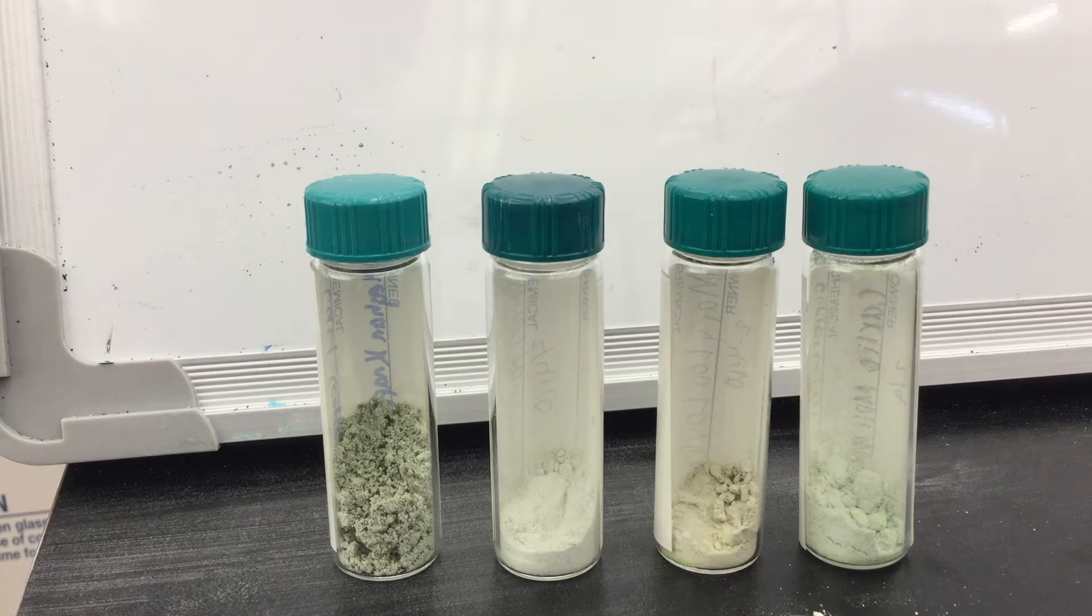The three bottles to the right are samples from two years ago, so the one that is second from the left has maintained a very white color. The others were fairly white to begin with and have slowly started to turn a pale green.